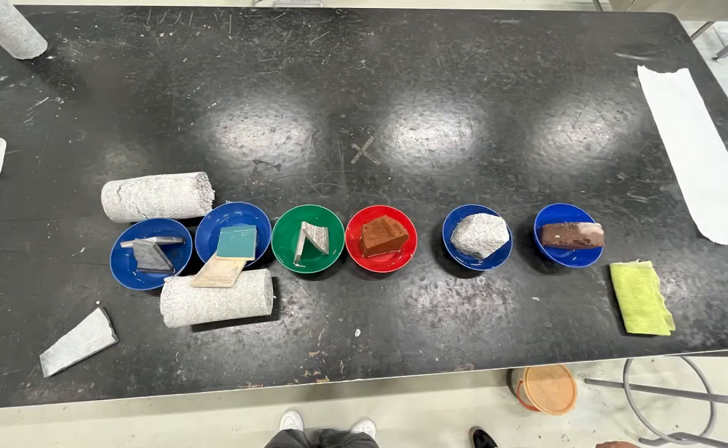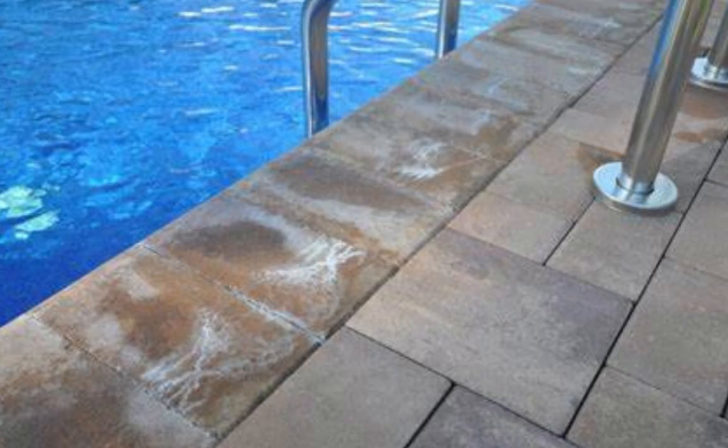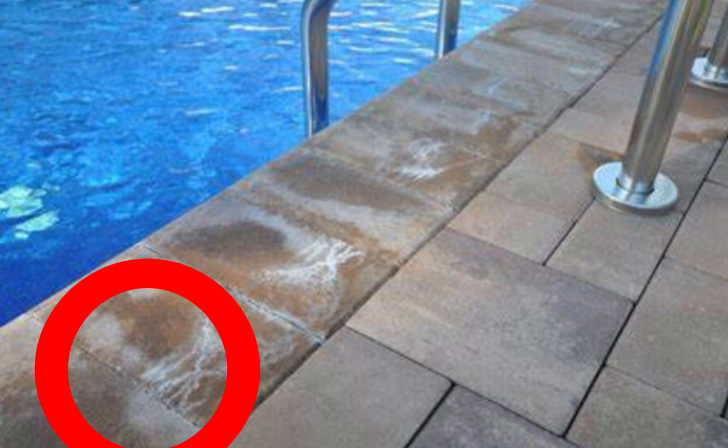During this experiment, we looked at the sodium sulfate-induced efflorescence in ceramics. The goal of the study was to comprehend the processes of deterioration that take place when environmental salts are absorbed by ceramic materials, leaving them open to chemical reactions.